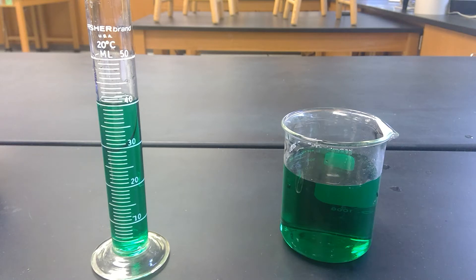In this case, it could be bonding to glass. There are two parts to this. One involves the graduated cylinder and the other involves this glass and some glass slides. But I'm actually going to start with part B, number two first.